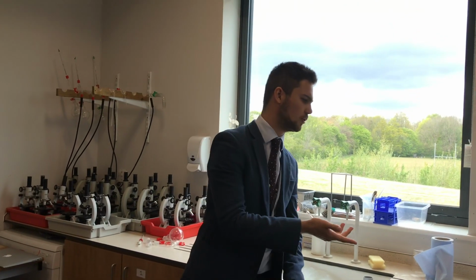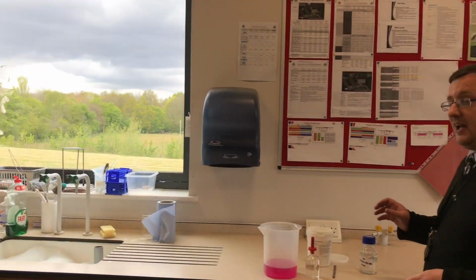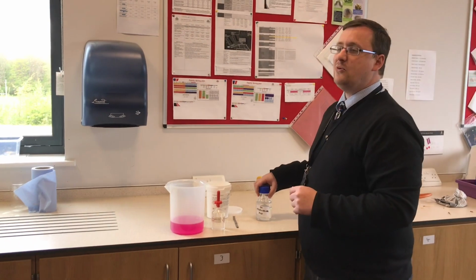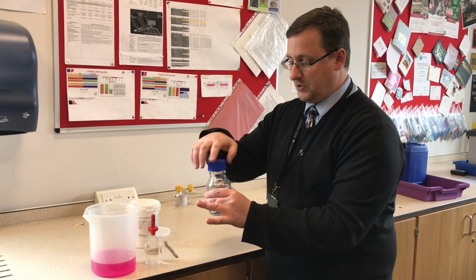So based on that, Mr. Walker, is there any way that we can reverse this reaction and change the colour back? Oh, you want to make it back to colourless again or transparent? Yeah, I'd be interested to see that. Absolutely. I knew you were going to ask that, and that's why I brought the acid. So let's see what happens if I put it in.